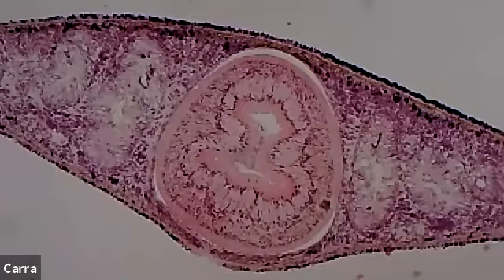All right, but unlike an elephant trunk, which kind of stops at the front of the elephant face, right? This kind of goes into the body cavity. It would be as if the elephant trunk extended down into the esophagus and then all the way into the stomach. So this feeding tube goes all the way into the stomach, basically, of this planarian.